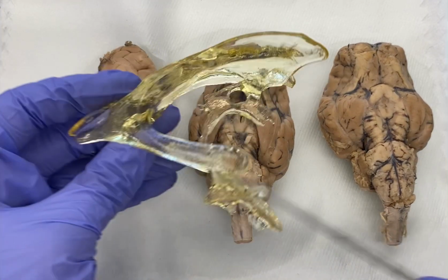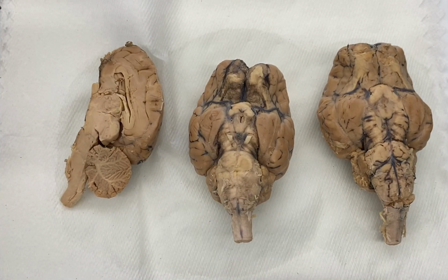Now, I mentioned that you have this subarachnoid space around the brain and around the spinal cord. In the brain, however, we have these little extensions called arachnoid villi, or arachnoid granulations, which are extensions from the subarachnoid space that allow the CSF to be drained ultimately back into the blood. So the CSF comes from the blood and it's ultimately returned back to the blood. These are called arachnoid granulations, sometimes arachnoid villi.